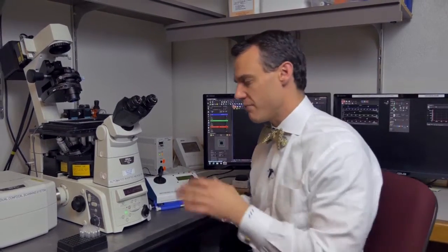Now this instrument here is a finely tuned, highly sensitive machine. You're able to get amazing resolution, and it is able to get resolution across multiple axes, including the Z axis. It involves multiple lasers, and it gives an amazing ability to resolve in real time how living cells are actually interacting with their environment and with their fellow cells.